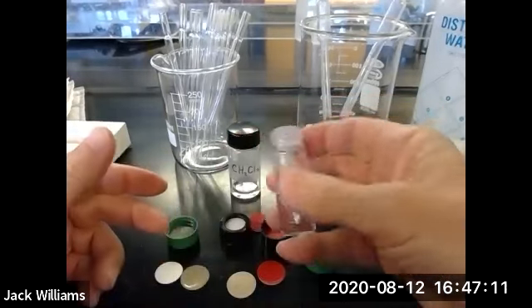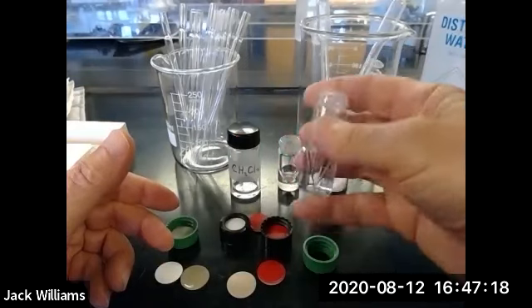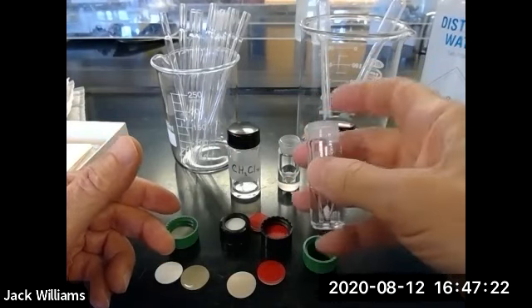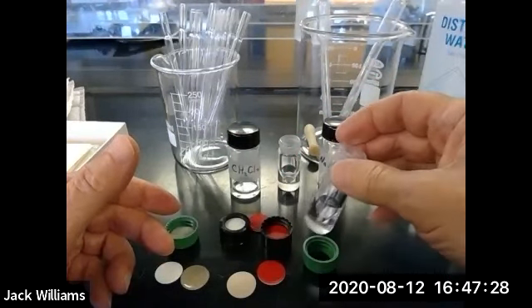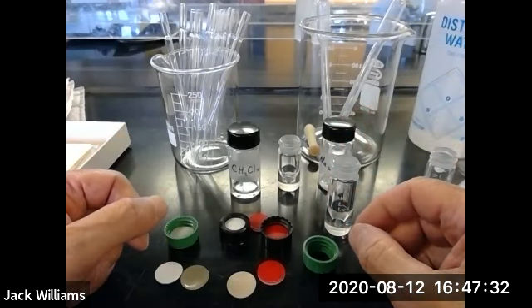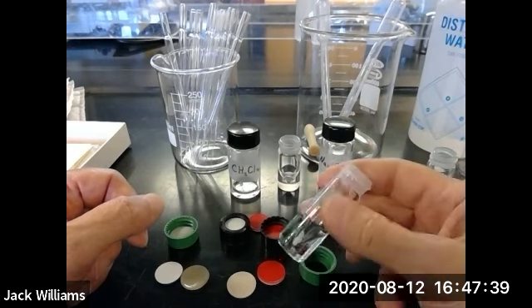And to this, we're going to add methylene dichloride. And then we're going to stir it around, allow the benzoic acid to dissolve in the methylene dichloride, and then we're going to add water. And that will create a system that contains 2 liquids. One is methylene dichloride, the other is water. They are immiscible, which means they don't dissolve in one another. And the benzoic acid, upon stirring, will distribute itself between the 2 layers. So benzoic acid is here.